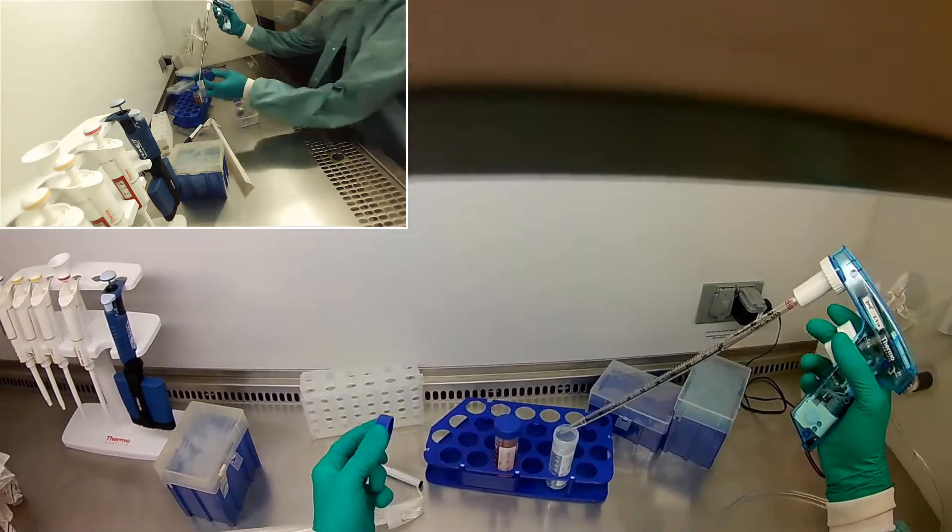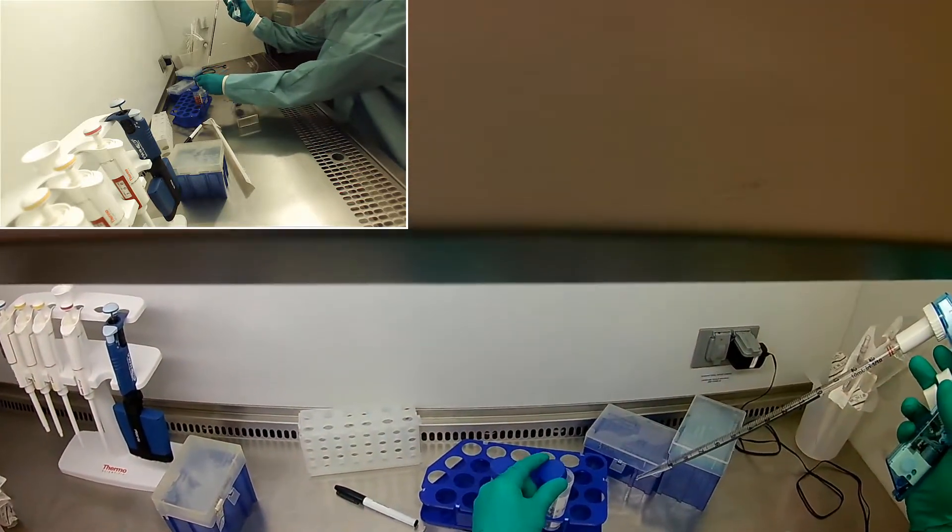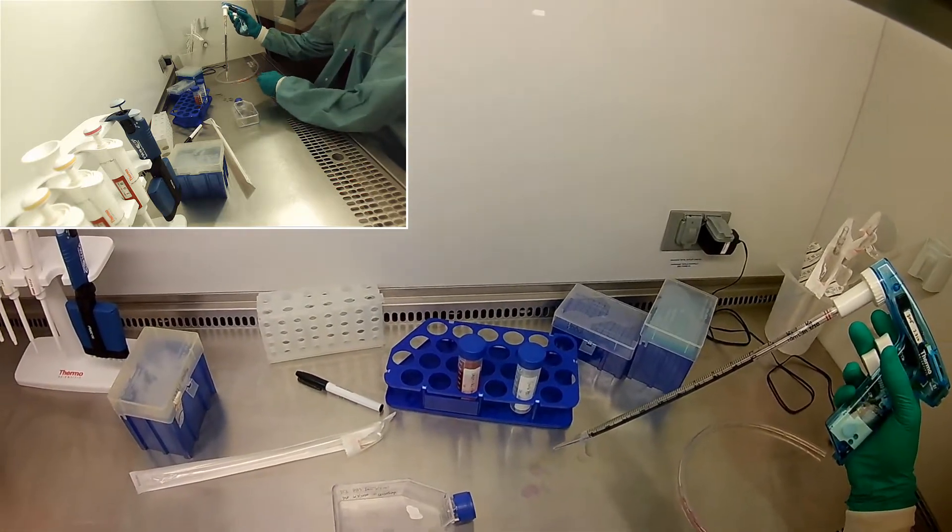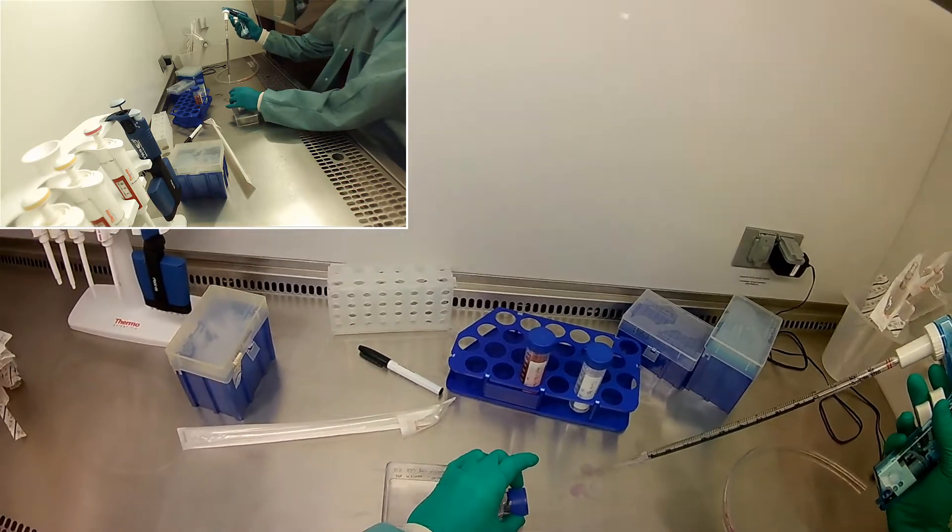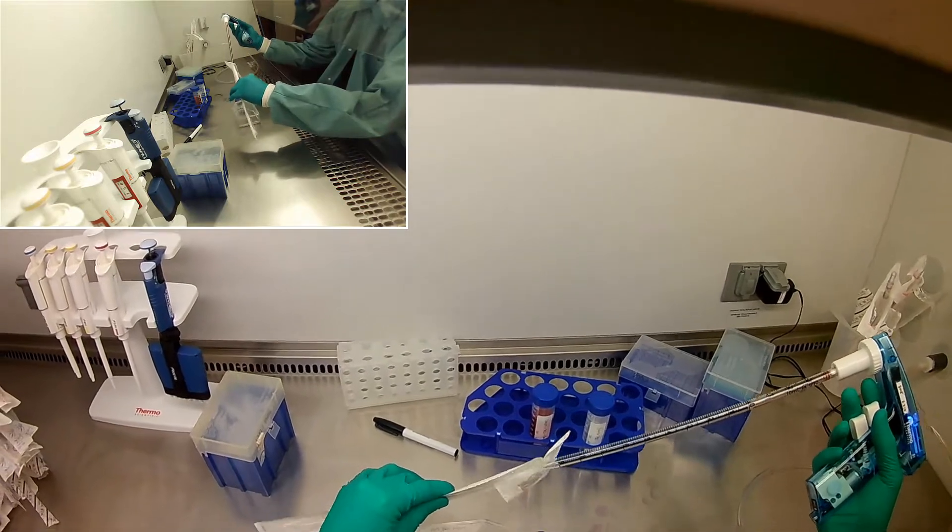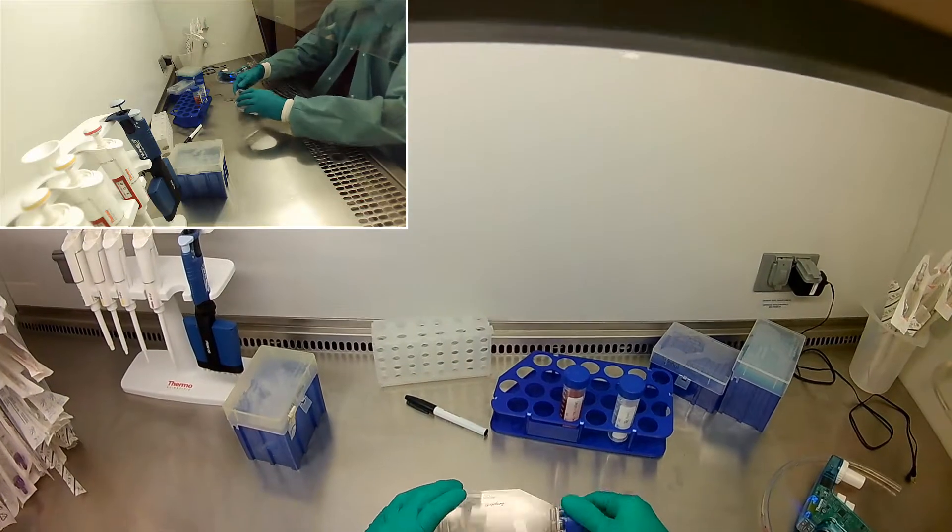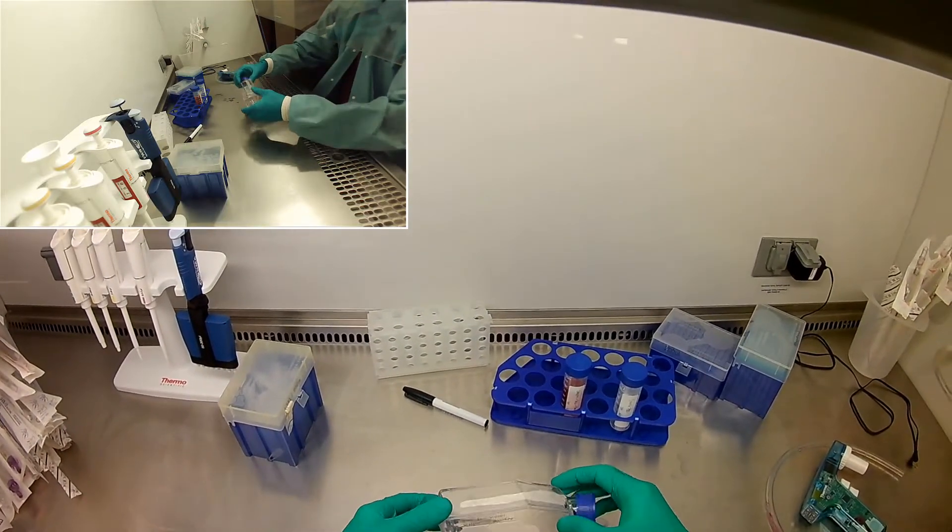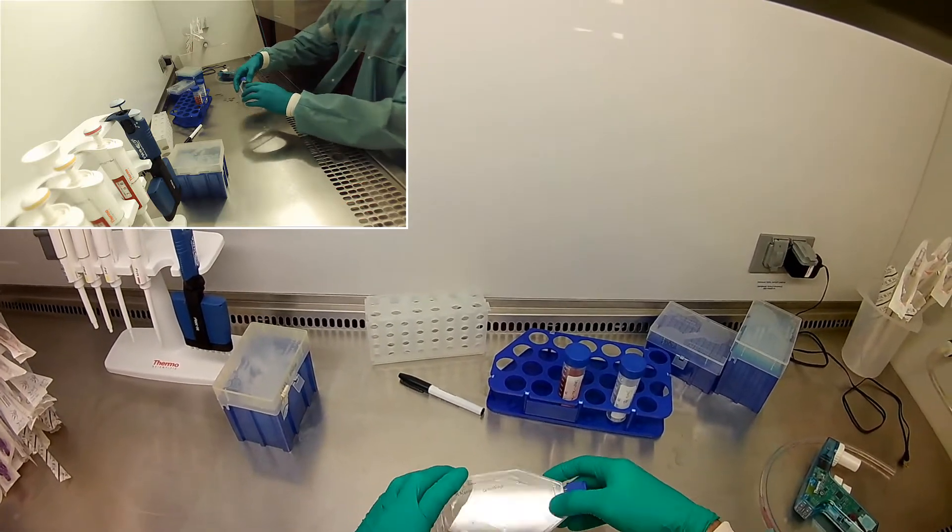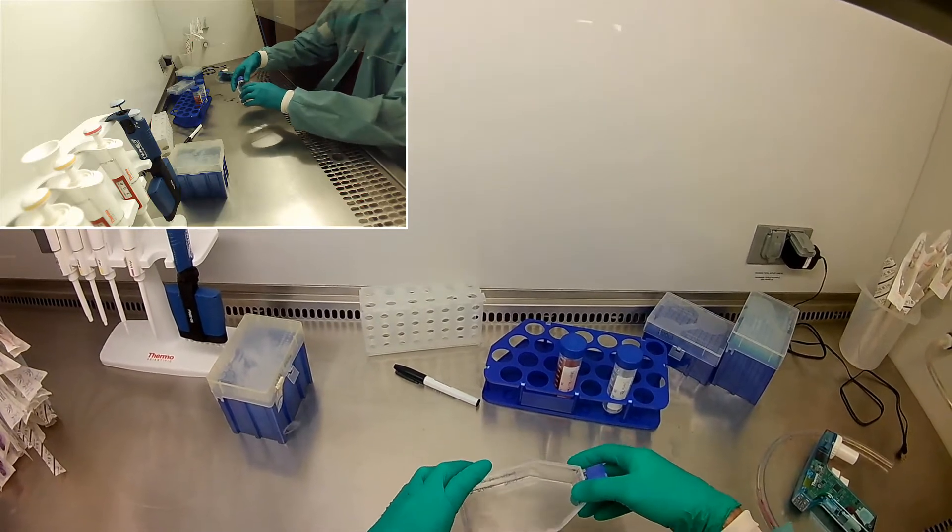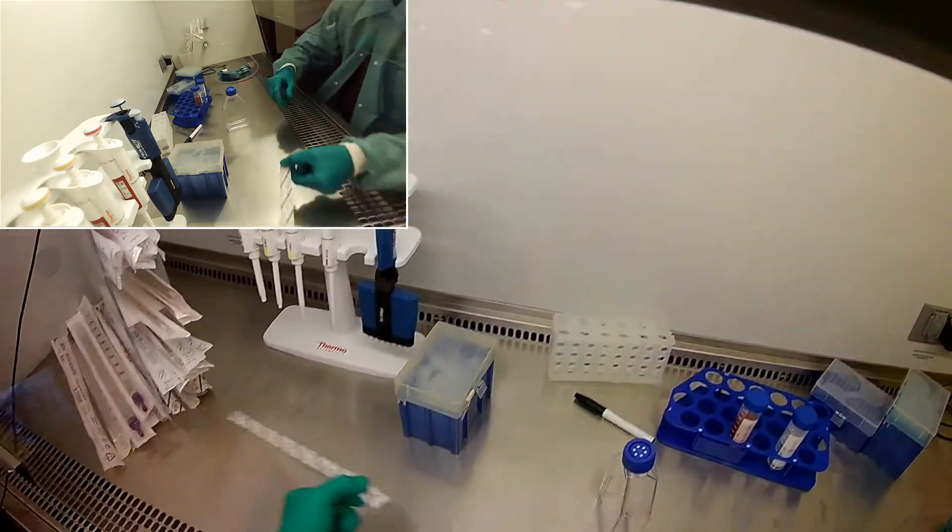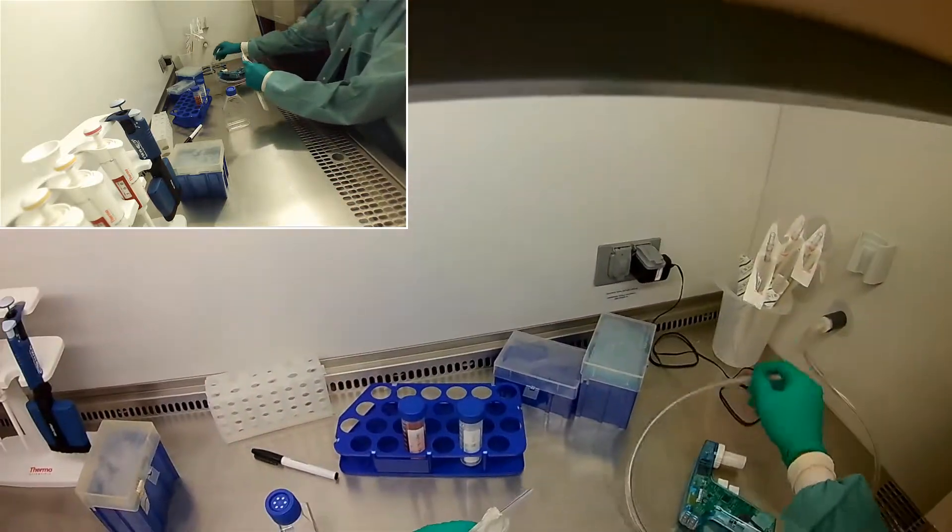Like I said, we're just going to use some PBS to wash off these cells and make sure that anything that doesn't really want to be there doesn't have to be there. I'm not going to really take an exact measurement here, just however much. So you can see I can freely be careful to go over my flask because it's closed. I am careful not to contaminate the PBS. I do have this leaky pipetter, so I'm making sure it does leak over the metal bottom rather than over the flask. So I'm going to stick this in here, wash off. Now I'm going to close that, get rid of this pipetter so I don't have to mess with that, and then I could wash off everything. And so because I also got some media on the top, I'm going to go ahead and wash the top off as well. I'm going to really make sure that everything that doesn't want to stick gets its chance to rest kind of down in the bottom of the flask. So I'm even going to set the flask up like that so it's not sticking up while I'm getting this new aspiration pipetter.